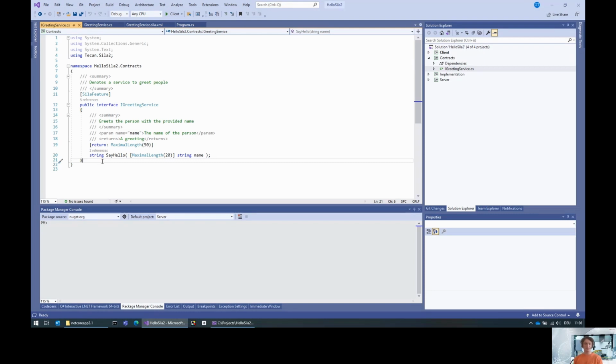The first thing, if you want to work with exceptions, is you need to define the exception that you want to work with. So I'm just putting this into the same file here. What exception do we want to have? If the name contains digits, then obviously it's not really a name, because names usually don't contain digits. So in that case, we want to throw an exception. I'll name that unfriendly name exception, because obviously you were trying to do something like phishing attacks or whatever. Therefore it's an unfriendly name.